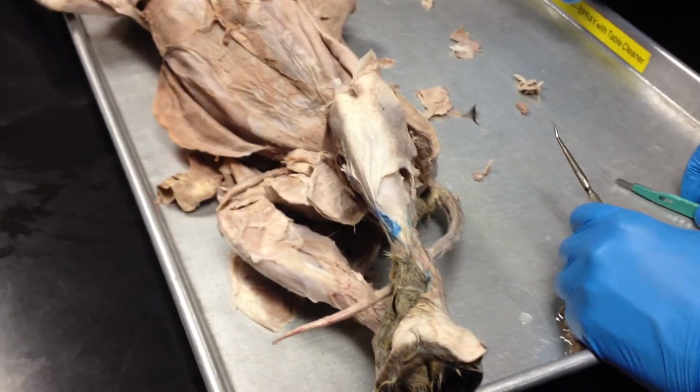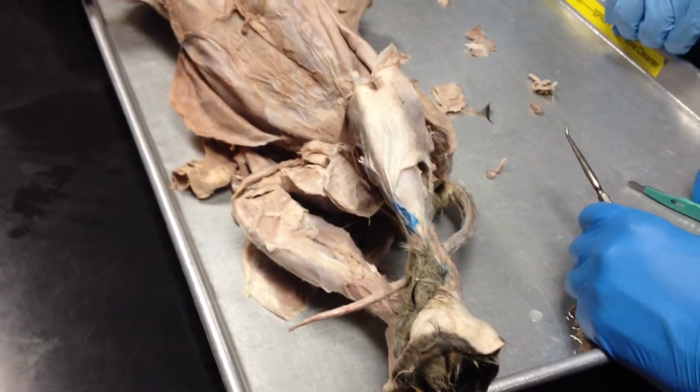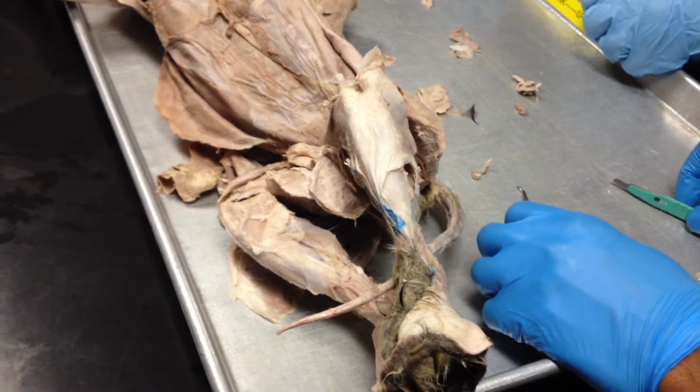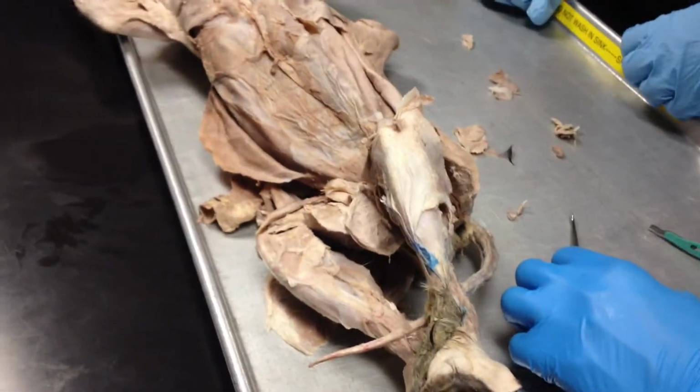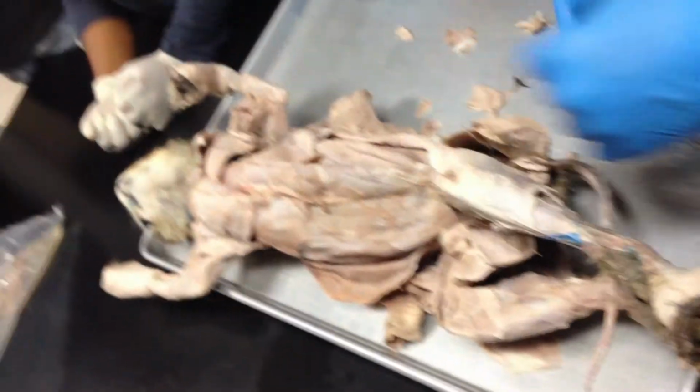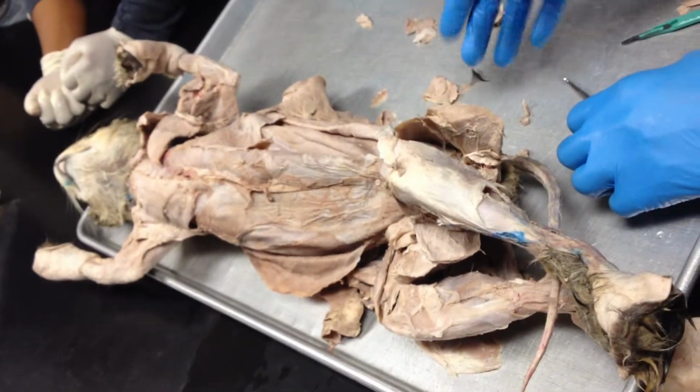Will you have another chance to work with the muscles in the cat? Yes, next time I will bring you a dried cat where those muscles are separated and you can look at them. But yes, for the exam, we have this type of cat where the muscles are separated. Your job on the exam would be to identify these muscles.